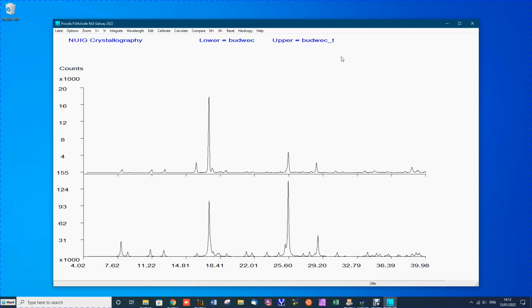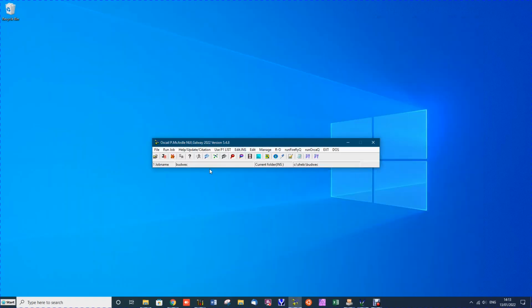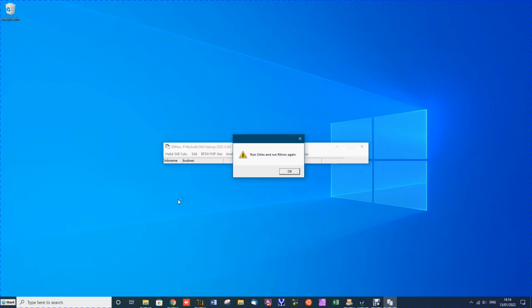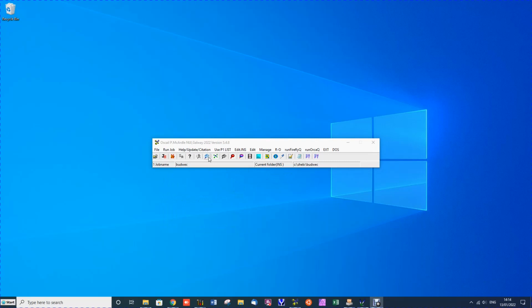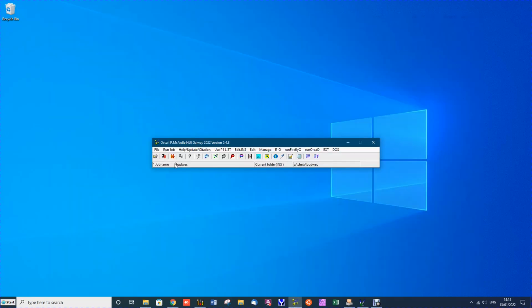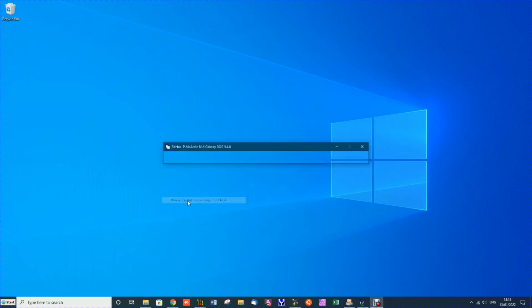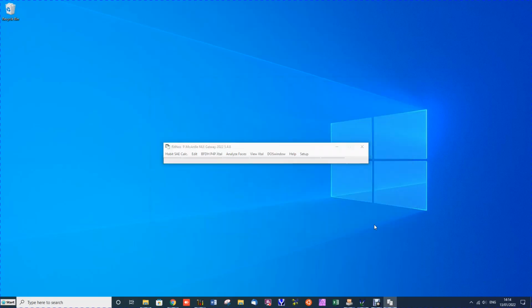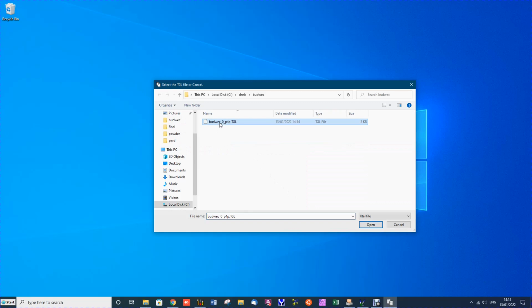Now we can try to understand this if we examine the shape of the crystal. To examine the shape of the crystal, we run job and look for Ritnos. We can see Ritnos program does crystal morphology, but it requires files written by Ortex, so we just run Ortex and close it and run it again, and you can see this time the program starts without problem. Now one of the options is P4P crystal. So if we ask it to compute a crystal picture or shape from the P4P file, we pick the P4P file, it generates crystal shape, and we just pick the only crystal shape that's there, and this is now displayed.